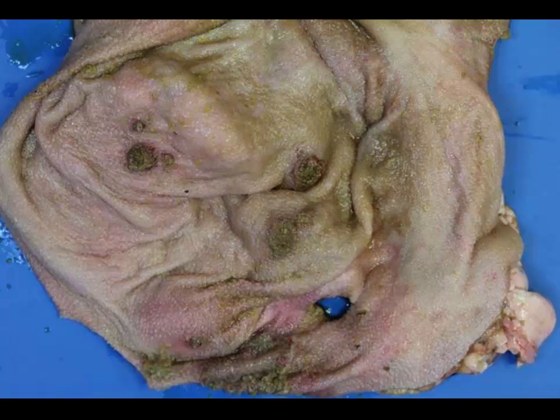A similar thing happens with the animals that are infected with malignant catarrhal fever virus. That's a vasculitis. It's a lymphoproliferative vasculitis. Affects the vessels, but you get large areas of gastric mucosal ulceration. Not because the virus targets the epithelium, but it targets the underlying vessels. Okay, once more, multifocal coalescing ruminal vasculitis with mucosal infarction.